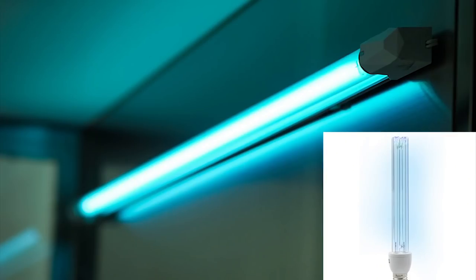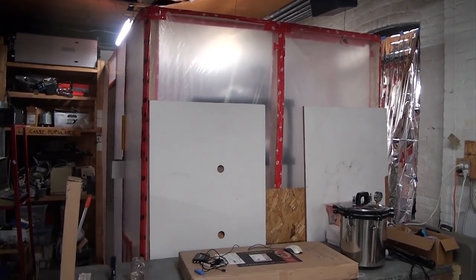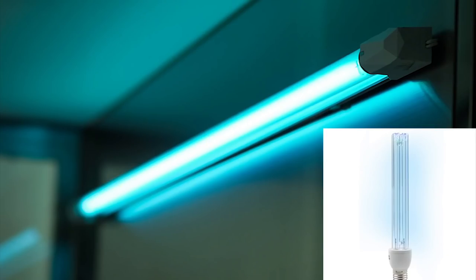The big one is a UVC bulb which will be used to occasionally sterilize the whole room, and drop down curtains on the outside to shield the rest of the hackerspace from the UV while it's running. But even then, it'll only be run while I'm the only one around, and I'll be in the other room for the duration of the run cycle.